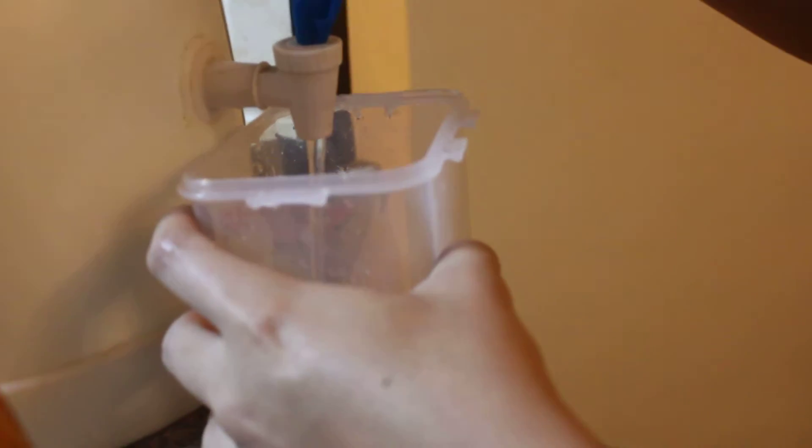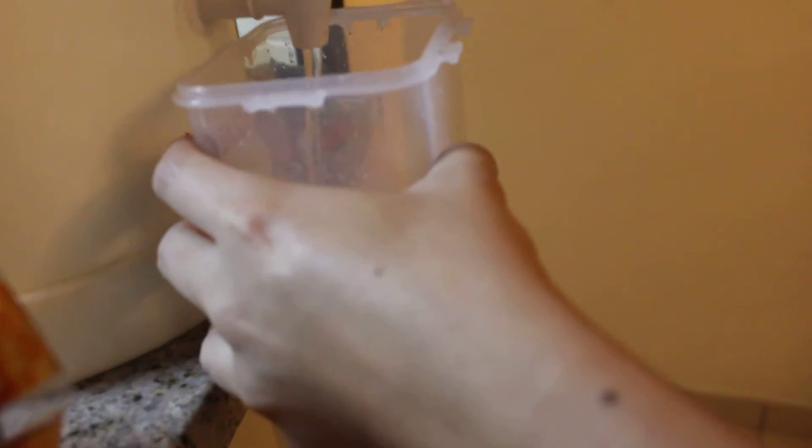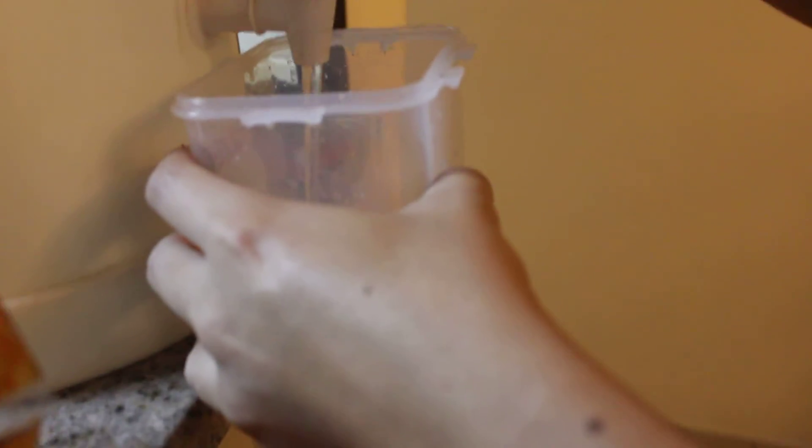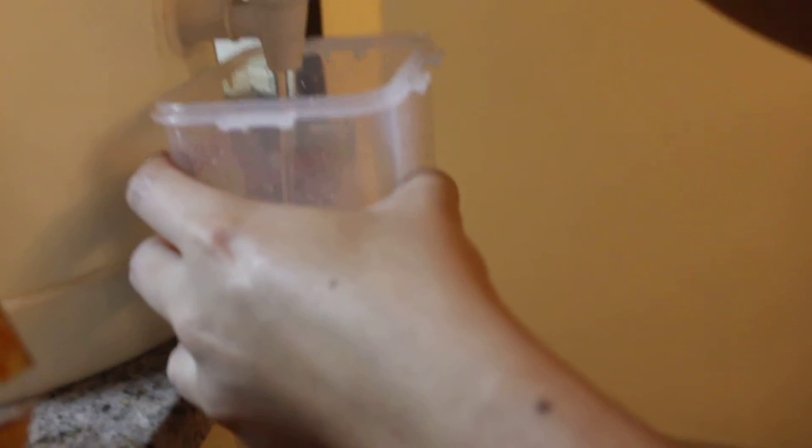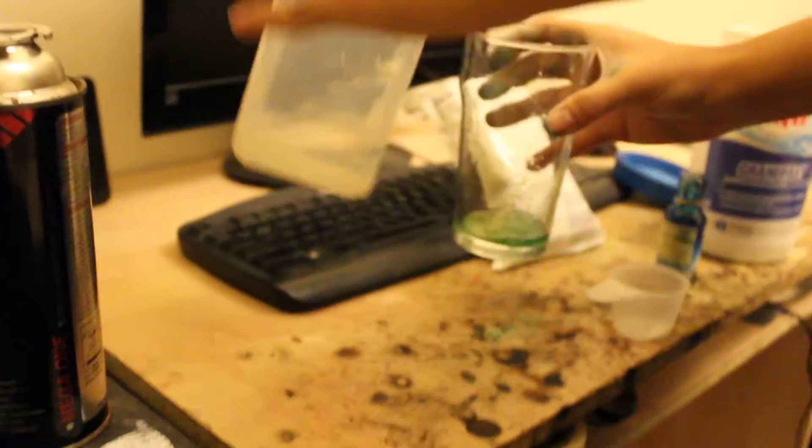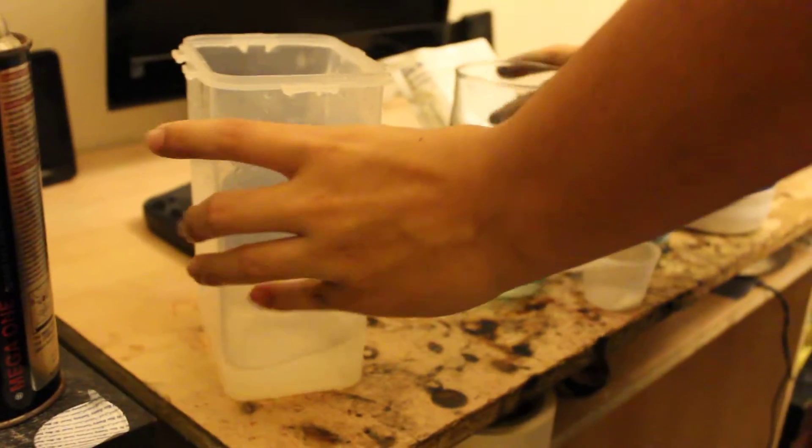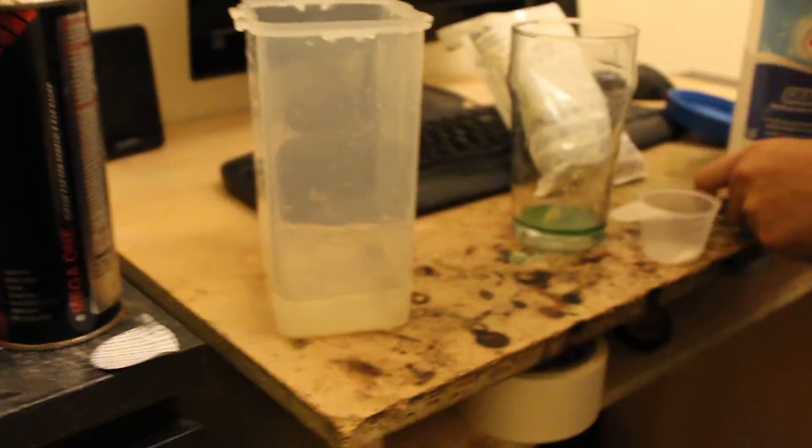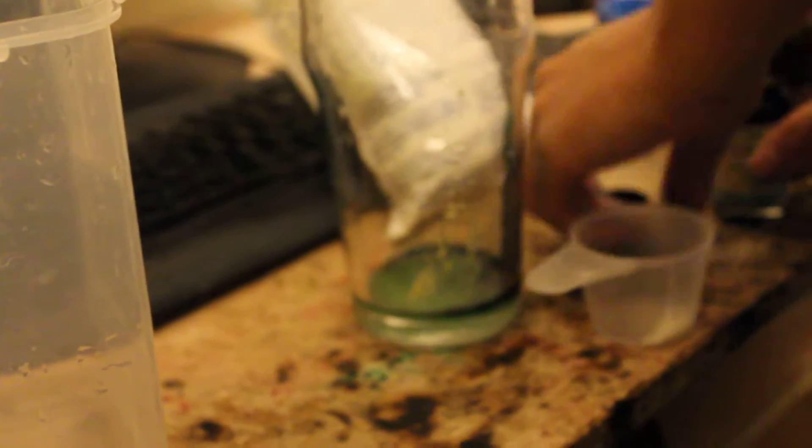Then I'm gonna go get some drinking water. I hope I washed it enough. There's three granules. It should be enough. I don't want to waste it again. That was too much last time, but it was proving a point here. So anyway, just like before, add a little bit of water. Still a bit of acid salt in here. Add a little bit of our indicator. Turns green. We're all set.